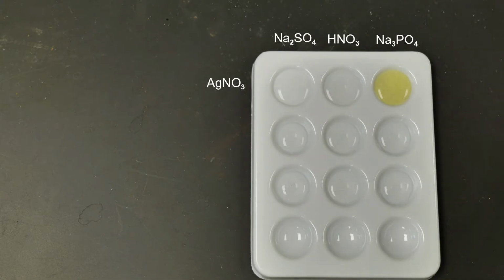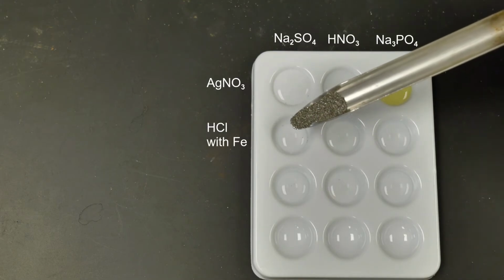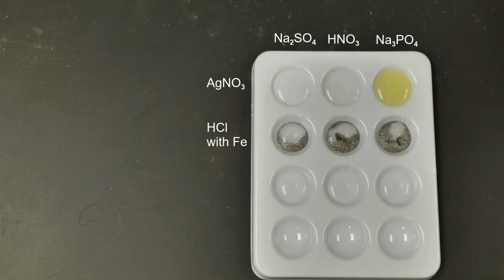For this middle row, we need to add a little bit of iron into our spot plate wells. I just have a bottle of iron here, some iron filings. So I'm going to add a little bit into each well. And then from here, we are going to add hydrochloric acid. Again, we're going to make note if we see any kind of chemical change occur.